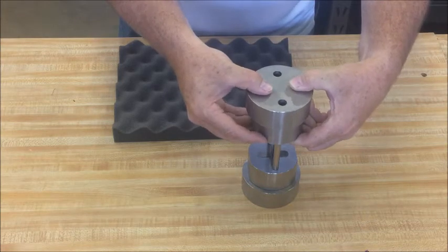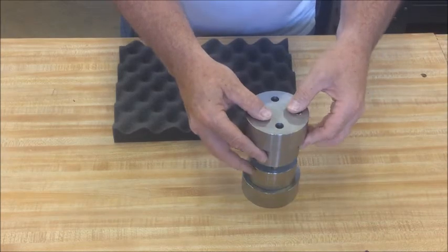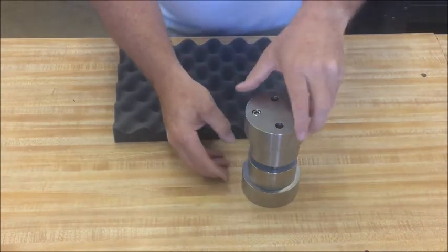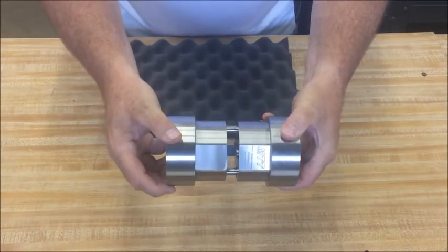Slide this down until the grip faces come in contact and the fixture is loaded with the specimen ready for testing.